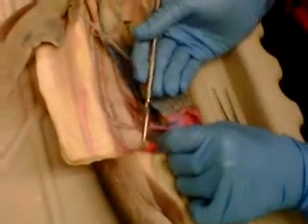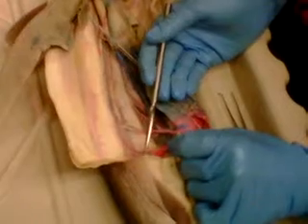The thing right here that goes from the dorsal aorta to the spleen is called the gastrosplenic artery. And right down here, from the dorsal aorta to the rectal gland, is the posterior mesenteric artery. Okay, so now on to veins.